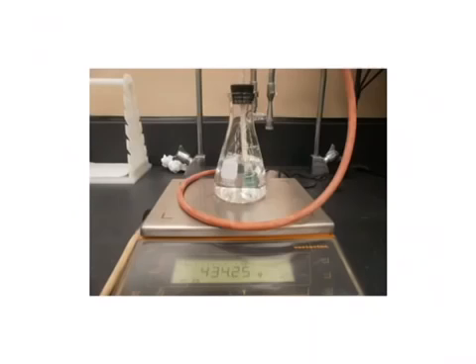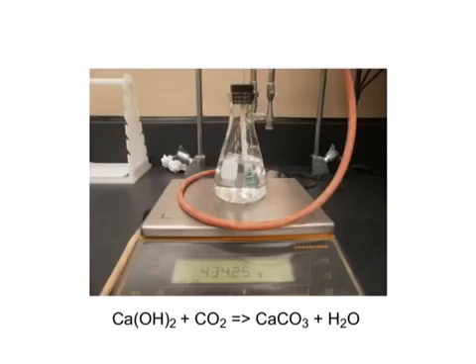So we weigh our calcium hydroxide trap before sending the exhaled air through it. Then we weigh it again after we have sent a certain amount of exhaled air through. The mass that our apparatus will gain is going to be equivalent to the mass of carbon dioxide that we are able to capture from the exhaled air.